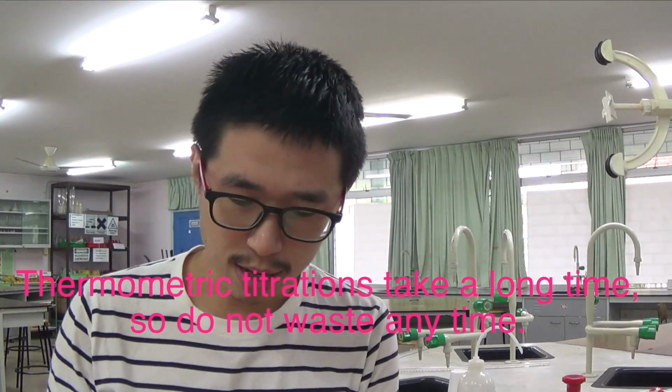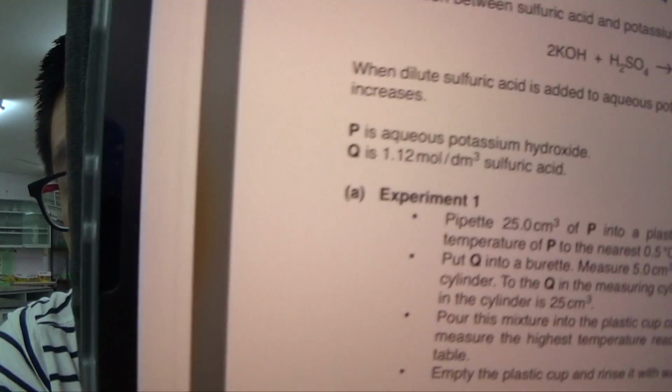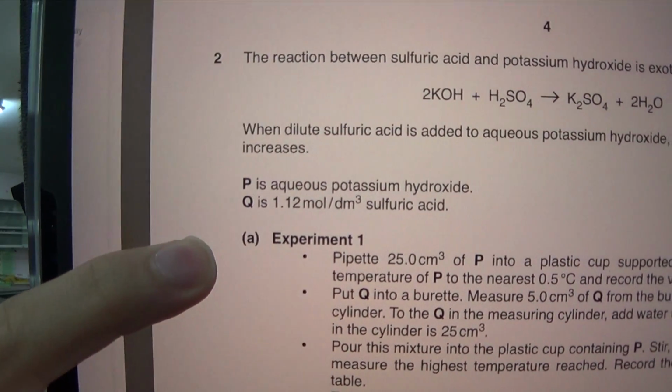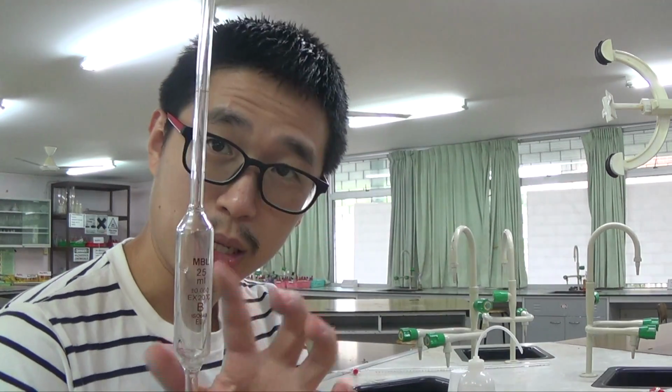So what do we have here? So this is the question. P is aqueous potassium hydroxide, Q is sulfuric acid. So P is potassium hydroxide, and P has to be pipetted out. This is a pipette, P-I-P-E-T-T-E. So I pipette 25.0 cm3 of P, which is potassium hydroxide, into a plastic cup supported in a beaker.